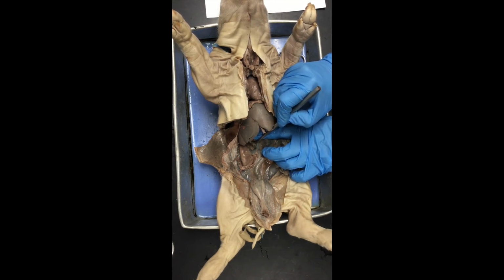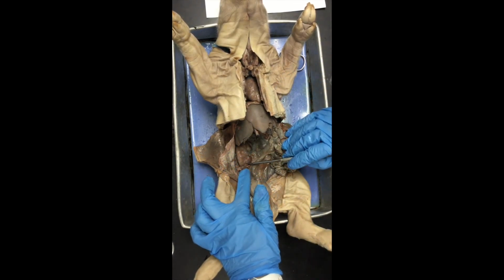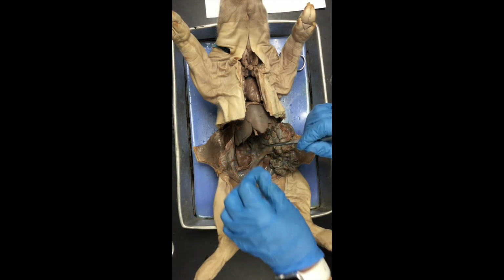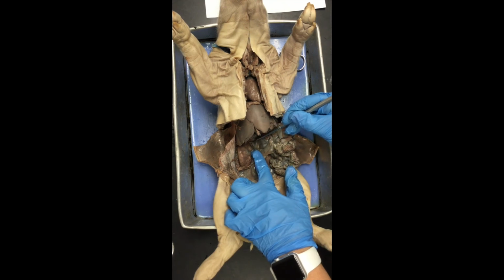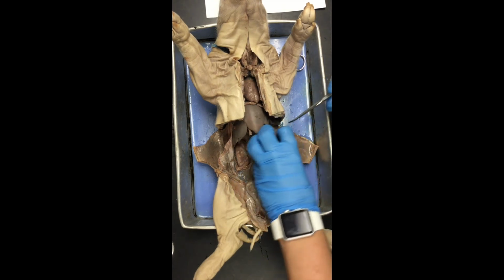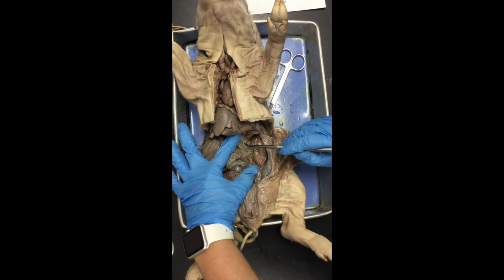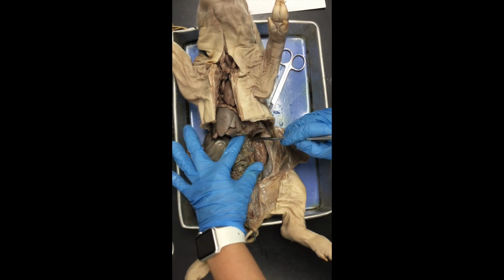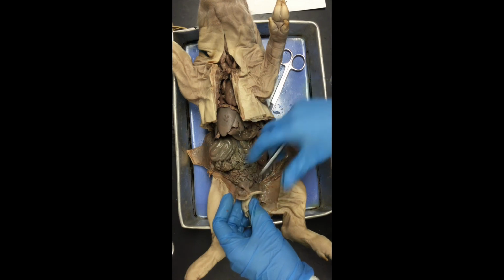These adrenal glands are very, very delicate. So when you remove the peritoneum from the top of the kidney, you have to be really delicate and slow, or else you'll just rip the adrenal gland right along with it. Okay, so keep that in mind if you're doing your dissections. Be very gentle in that area, because even me just rubbing the probe back and forth can sometimes rough up that adrenal gland a little bit. Okay, so we've got kidneys, adrenal glands, and then last on your list are the reproductive organs.